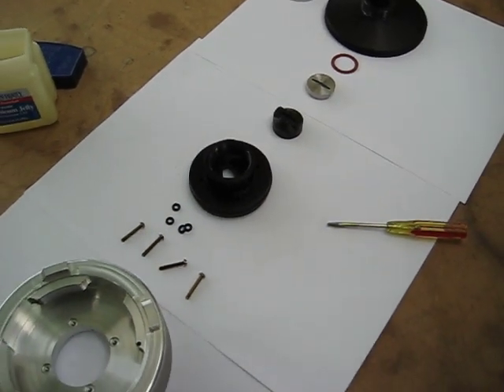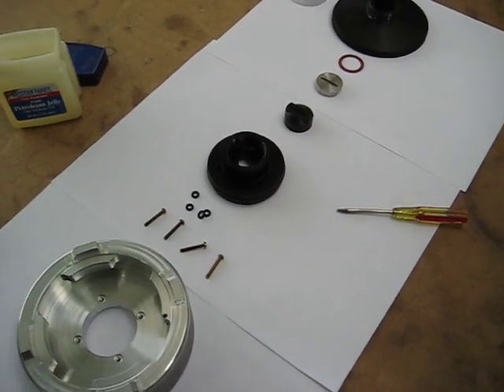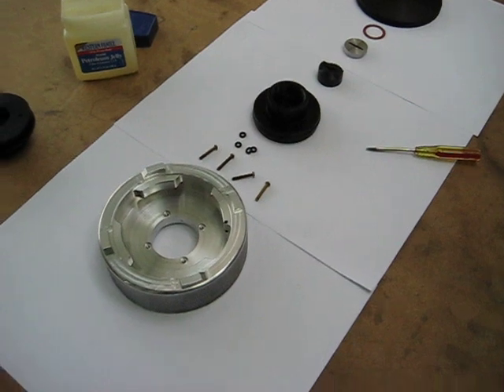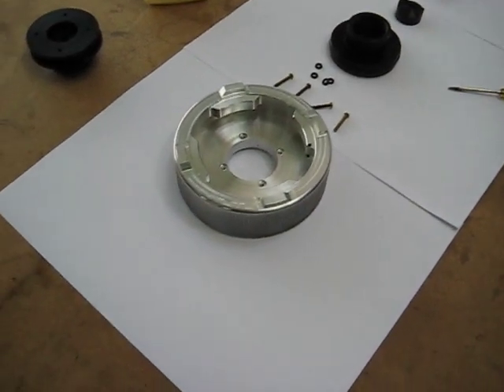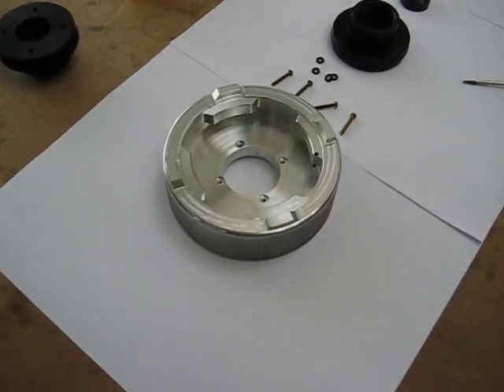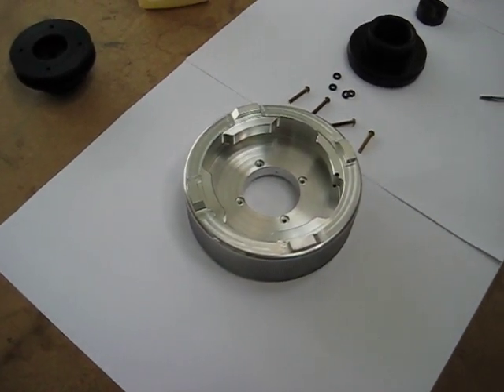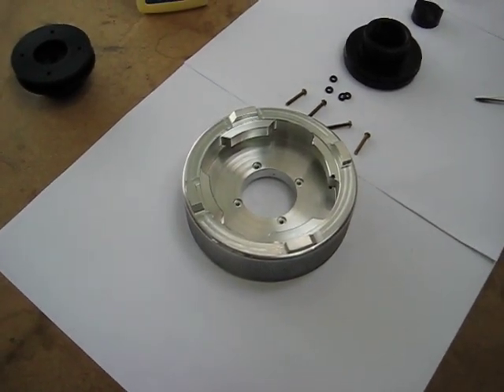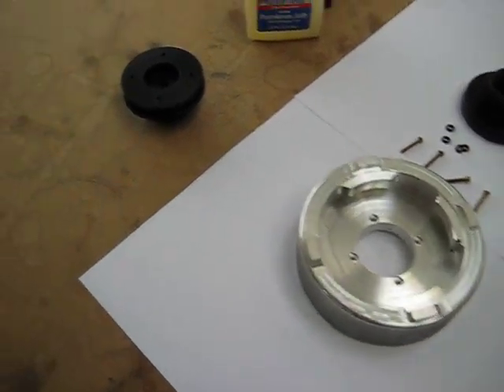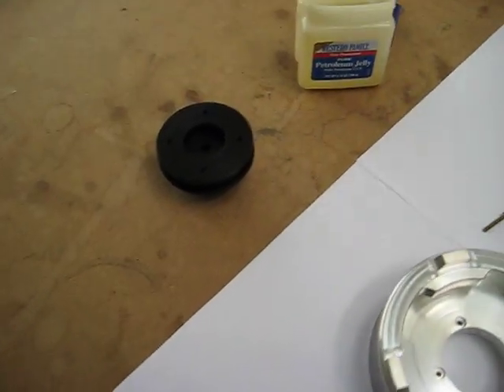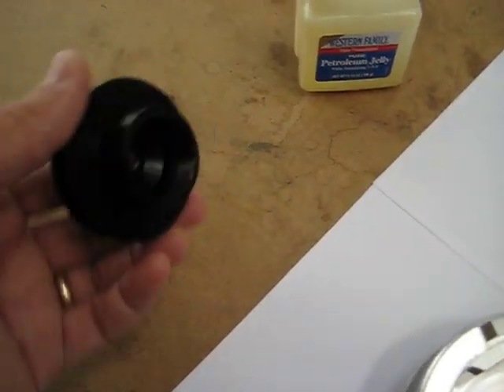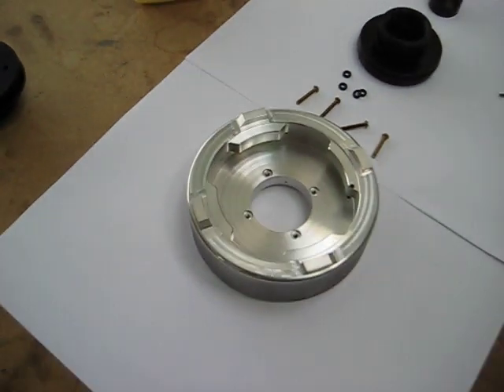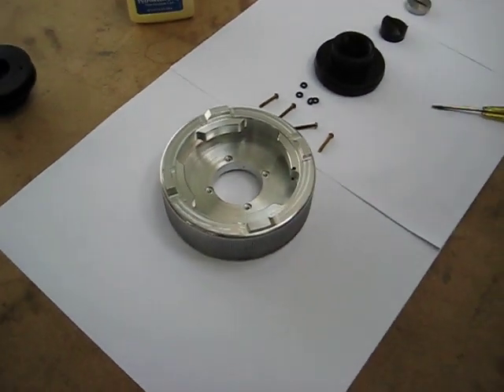This is a tutorial on how to install the grass compression gland. We're starting here with the lid completely disassembled. You'll have to have removed your other compression gland. You can see that this one's been removed and we're starting with the lid.